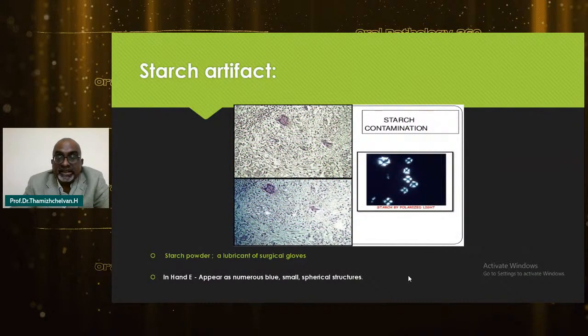And starch artifact is another common problem, especially in cytology, because of glove powder. The starch powder can be a problem, and it appears as numerous small blue spherical vacuoles, which can be confused for a pathological condition.